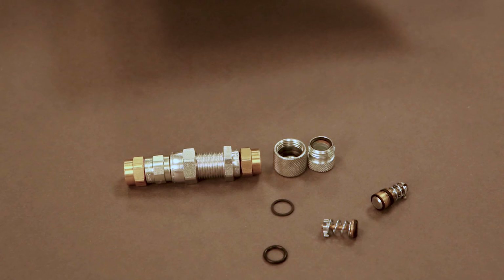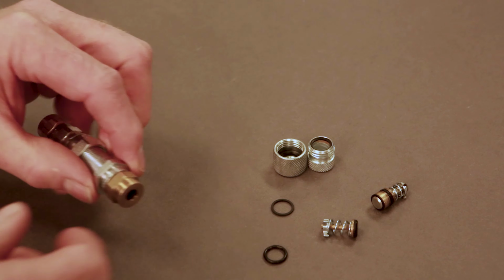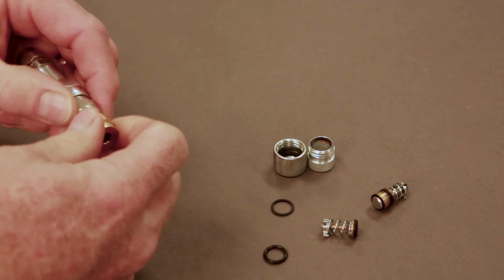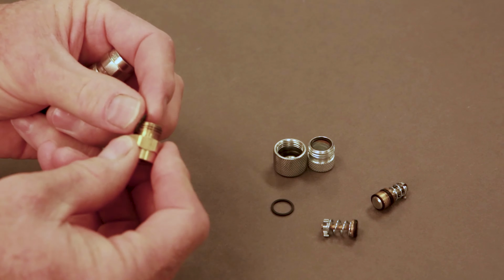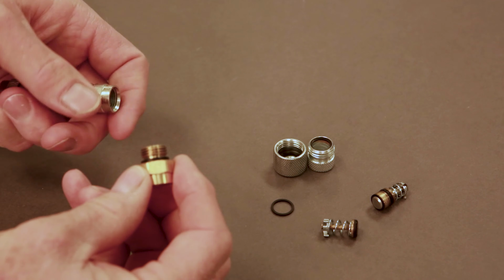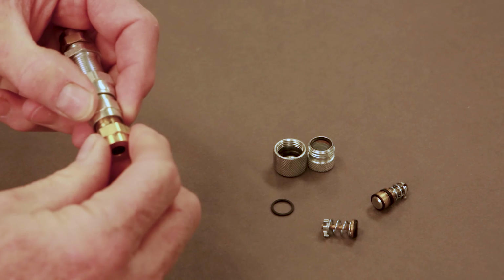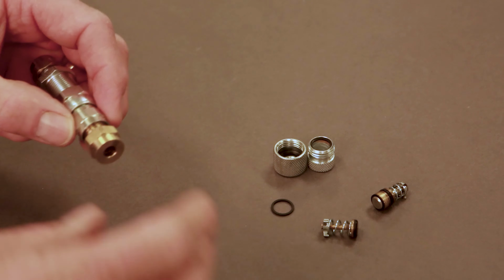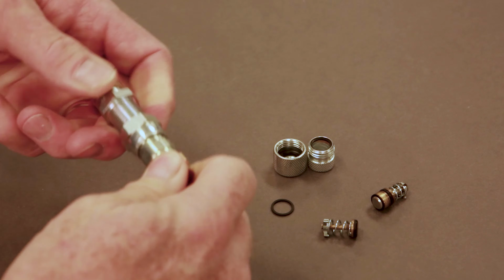So the components themselves are here. There is an O-ring that goes between the fitting and what it's connected to. And in this case, that O-ring is placed there. It would be lubricated before assembly, wiped off with a clean room wipe, and assembled with, again, the small drop of Loctite, using 5/8" wrenches to tighten.